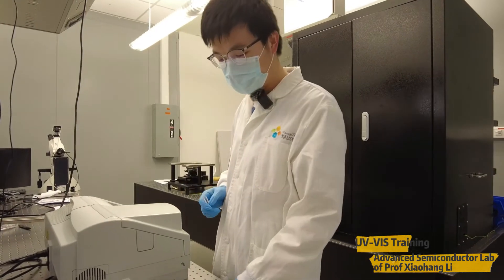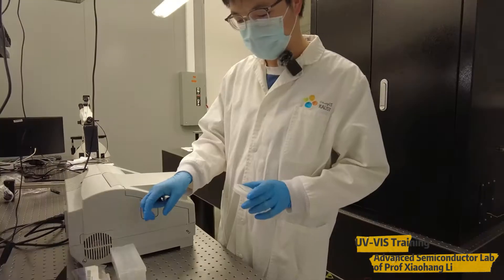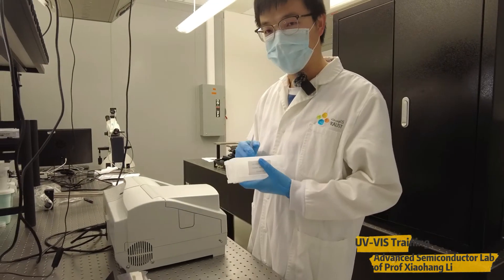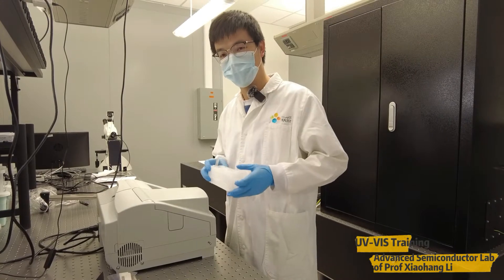Today I'm going to show you how to measure gallium nitride on sapphire substrate. To cancel the effect of the sapphire substrate, I'm going to use one sapphire as the baseline. Let's start the measurement.